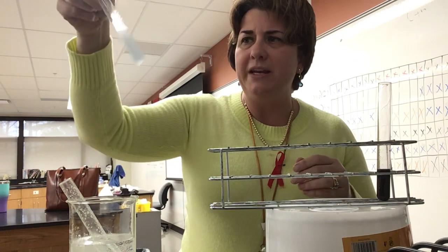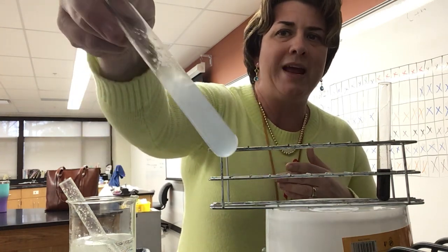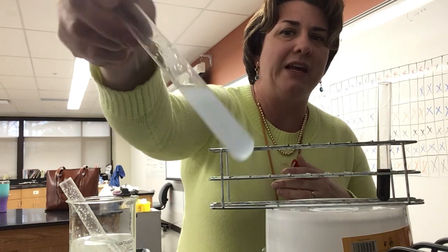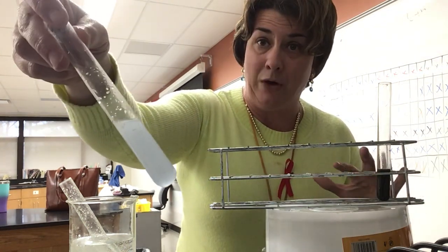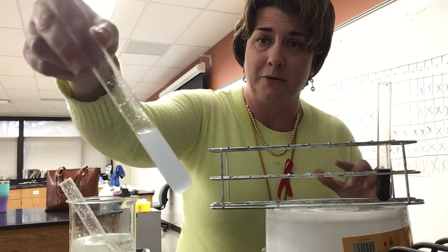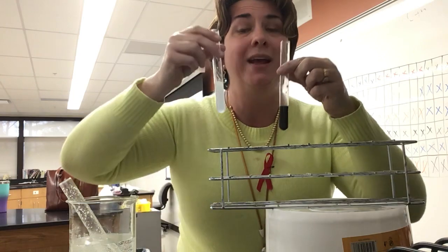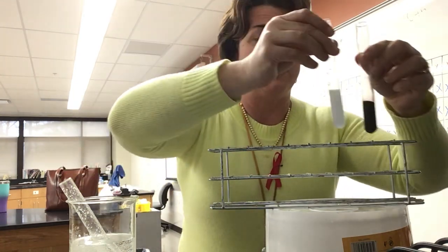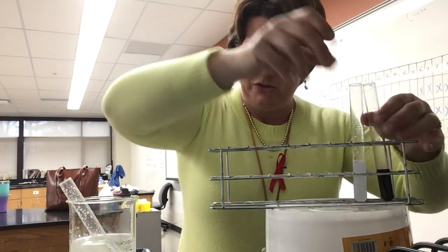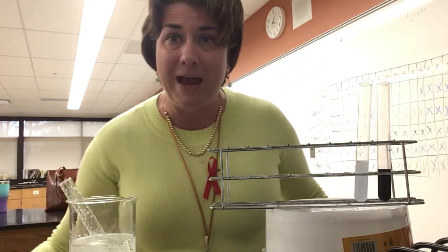And again, remember the tube is not clear, but what I'm getting here is basically a blue reaction. I'm not seeing protein present in these stomach contents, okay? So again, in our starch test, we definitely see starch. In our Biuret test for protein, we do not see any protein, okay? So let's go ahead and take a look at the brown bag test.